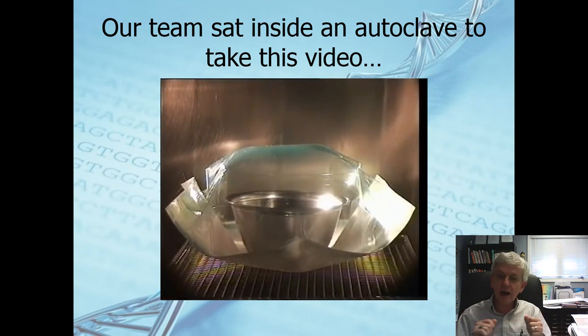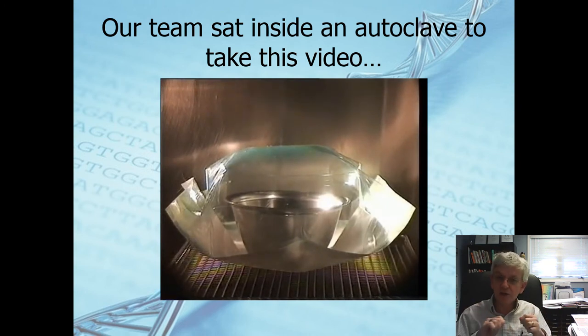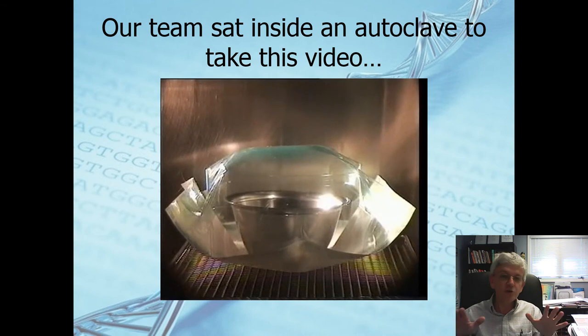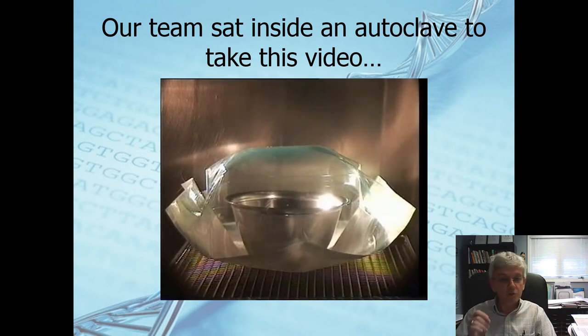Sealing the corners of the bags or the ends of the bags is really critical from this perspective. You'll understand now the placement of this, sealing things, getting things just properly placed, following that load configuration that you've been given is really key.